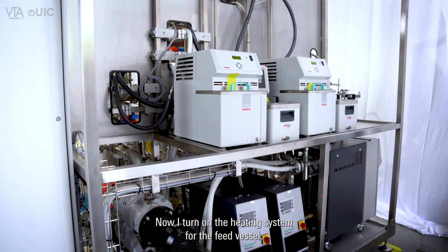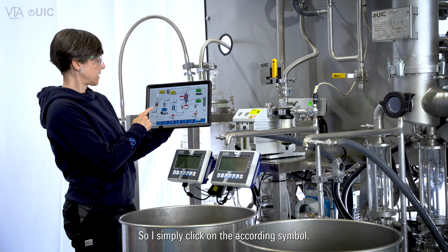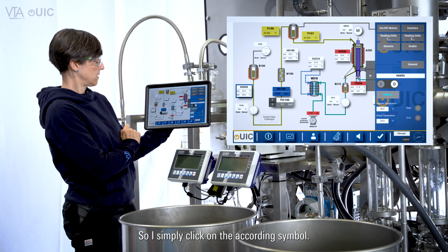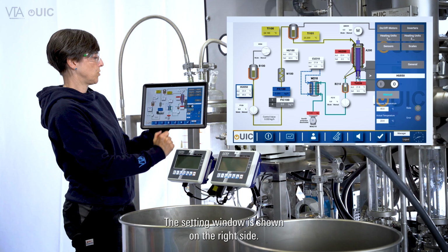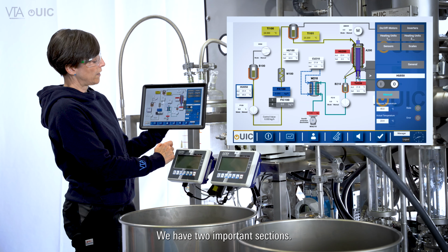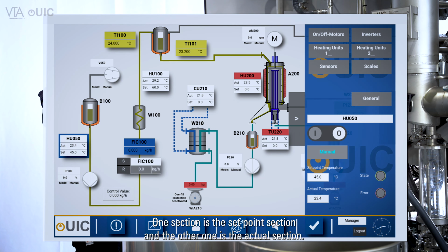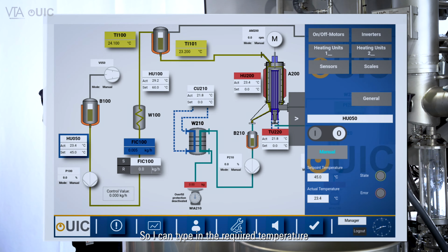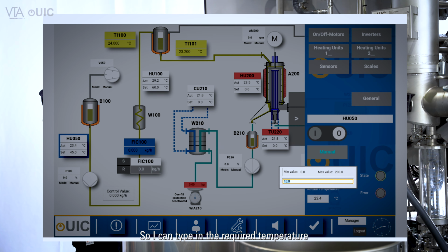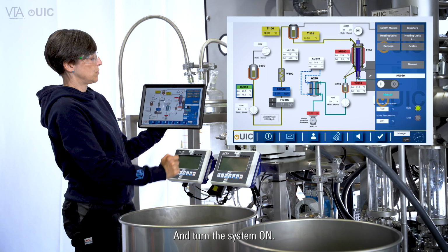Now I turn on the heating system for the feed vessel. So I simply click on the corresponding symbol. The setting window is shown on the right side. We have two important sections. One section is the set point section and the other one is the actual section. So I can type in the required temperature I would like to have for the feed vessel and turn the system on.